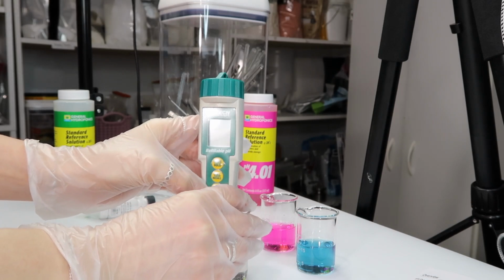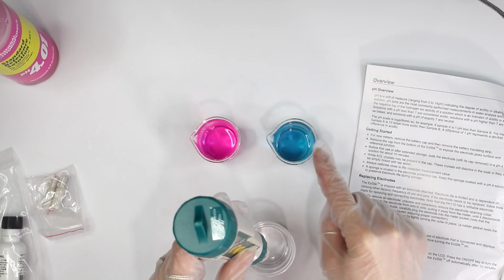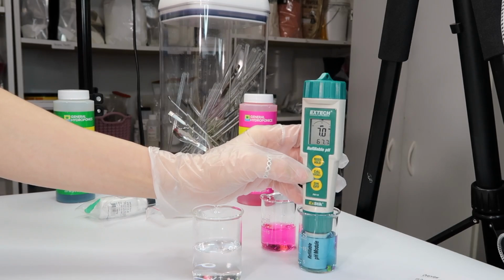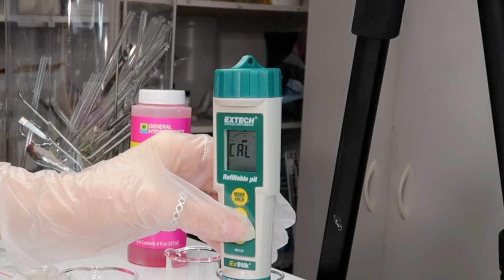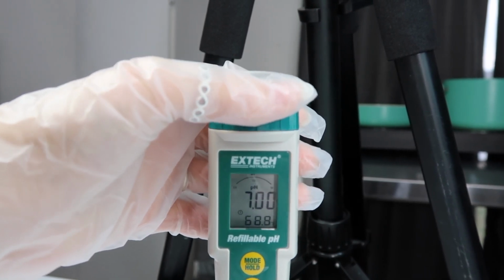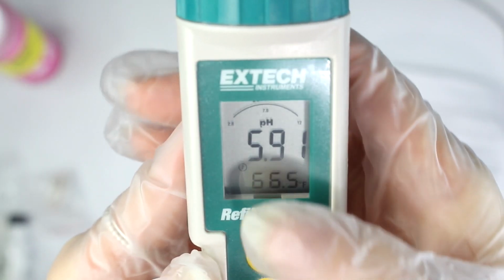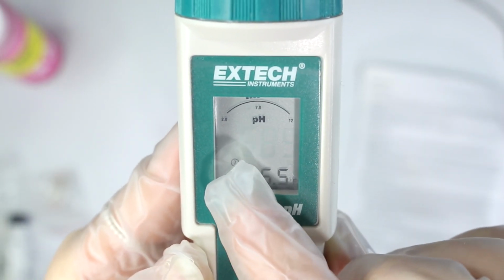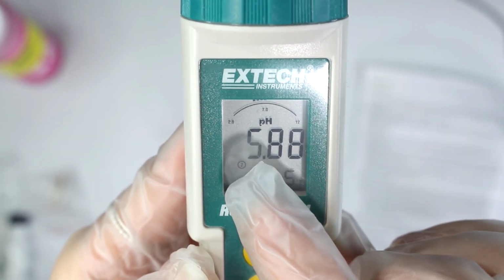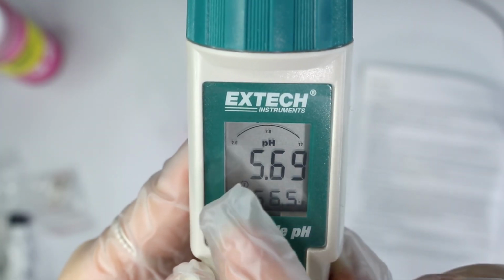Make sure your pH meter is on by clicking the on button, which is down here. You first want to dip it into the 7 pH solution and then press cal. It'll start flashing cal, then flash 7 repeatedly, and then it'll say end once it's finished. Then you can take it out and dip it into your rinsing solution. If you can see right there, there's a little tiny circle with a 7 in it, and that'll show up when a calibration was successful. So it's successfully calibrated 7, and after we calibrate 4, there'll be a little 4 there.